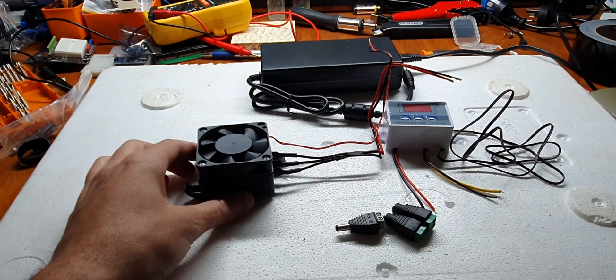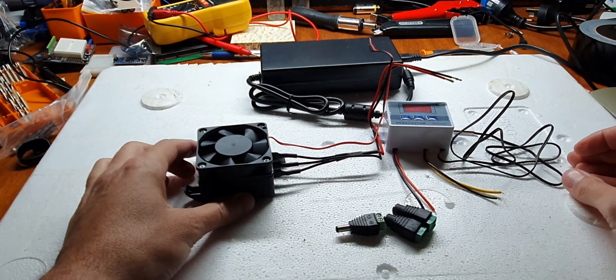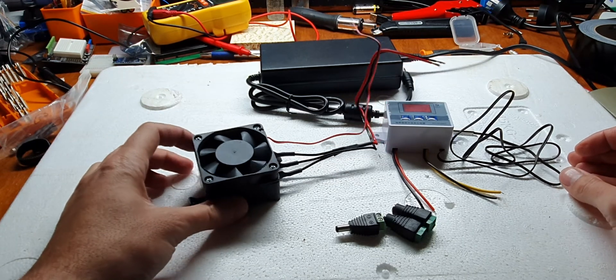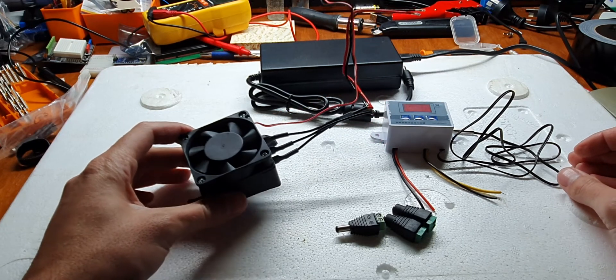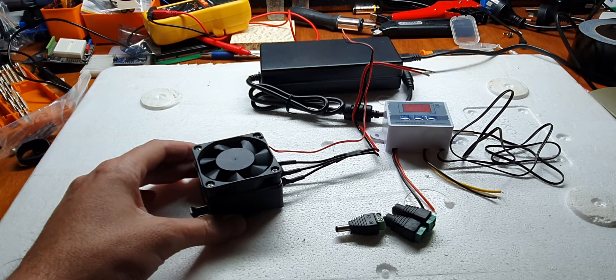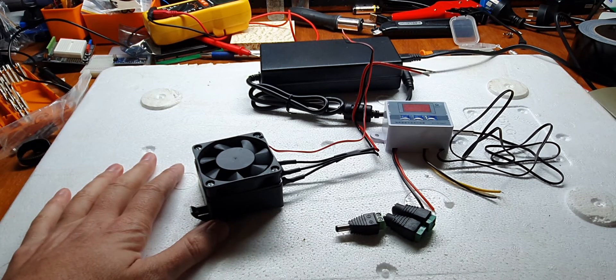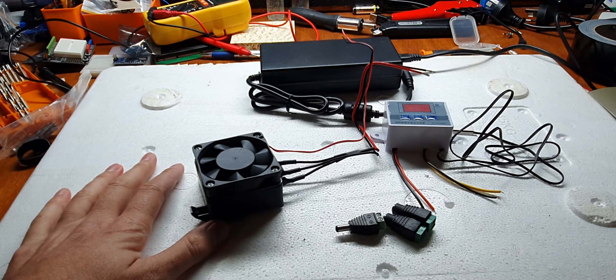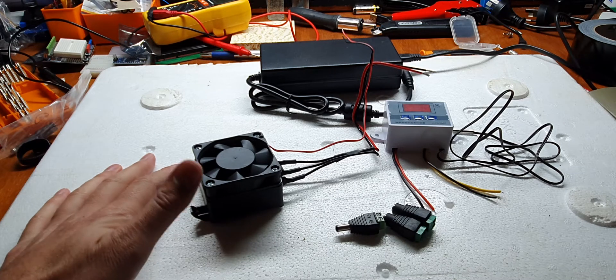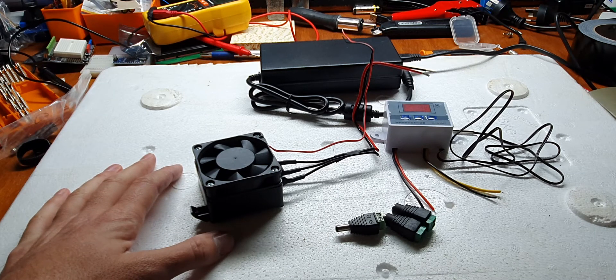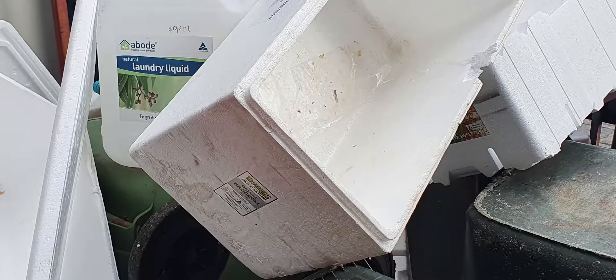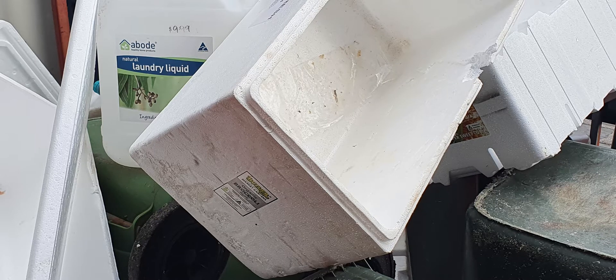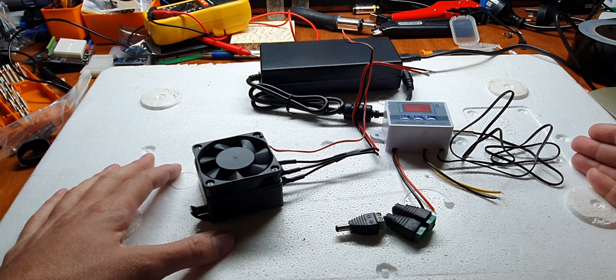Everybody, so I was on the hunt for an incubator. I was planning to do some projects at home with microbiology, but this video is intended for anybody else who maybe couldn't find a cheap incubator on eBay or was just wondering what a really cheap incubator build might look like. The only thing I did have to go out and find for myself was a styrofoam container which I'll basically be using as an incubator and buying all these bits and bobs here.